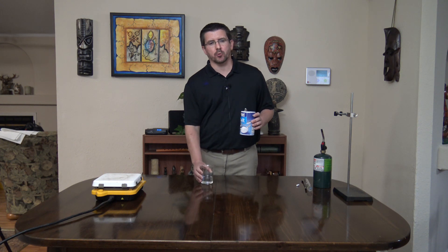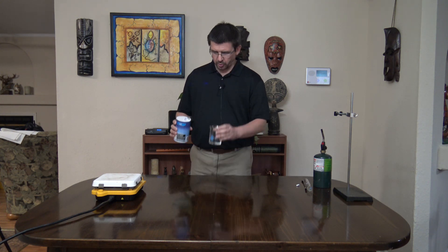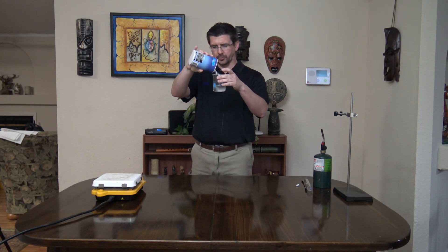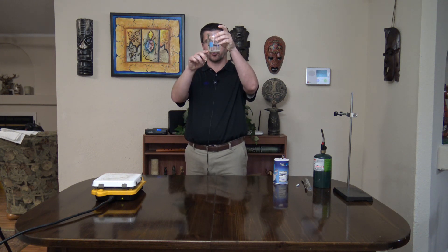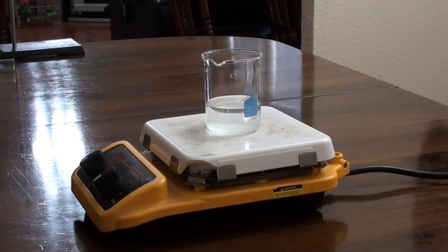In order to demonstrate this property of solubility, we're going to use two very common substances. The first is just water, and the second is salt. When we talk about solubility, we're basically talking about how a substance dissolves in another substance, or breaks apart into smaller pieces. So all I'm going to do is add some salt to my beaker of water here. You can see when we put it in at first, it just kind of falls to the bottom — we've still got salt on the bottom and water above it. But we're going to put it on the stir plate and allow this to mix up really good.